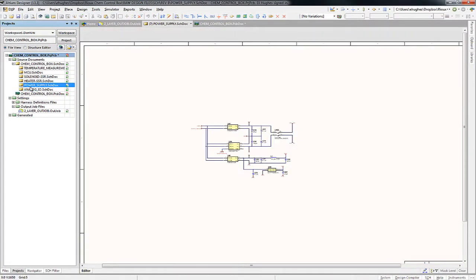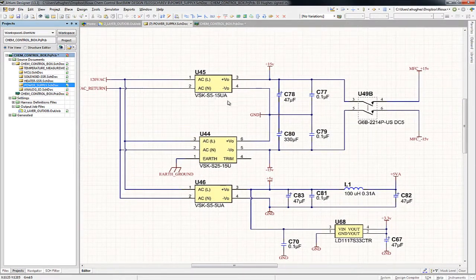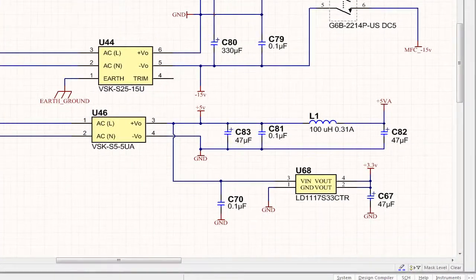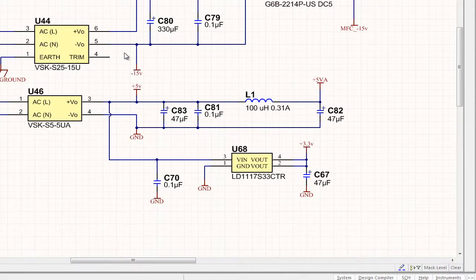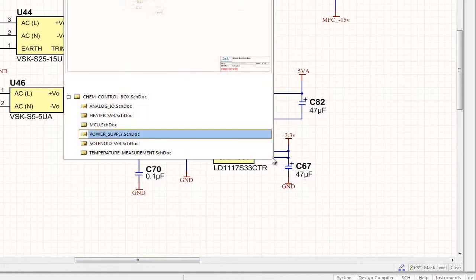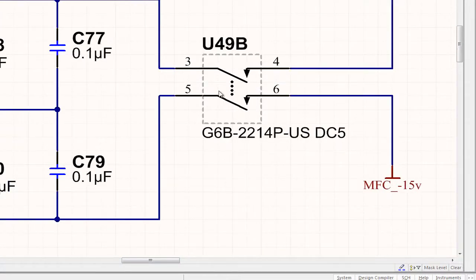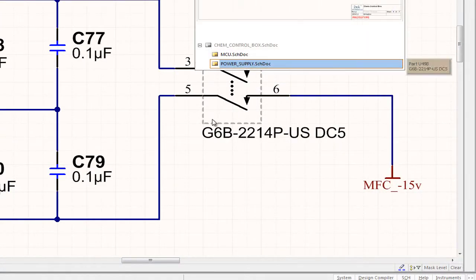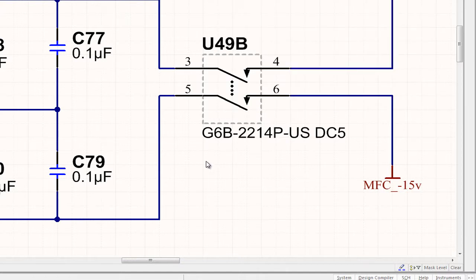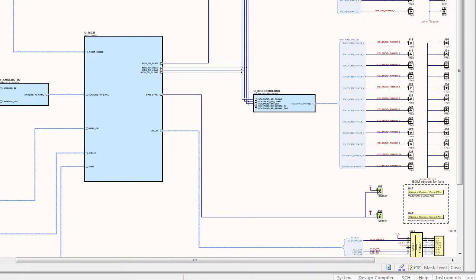So lastly, there's a schematic for the power supply. The power supply is some modules on the circuit board that take 120 volts AC in and give us plus and minus 15 for the mass flow controllers. And it also generates 5 and 3.3 volts for the Embed and the logic on the circuit board. The only thing to note, there is a relay that's under software control that will route power to the MFC mass flow controller jacks as needed. So that's the schematic from a high level view.